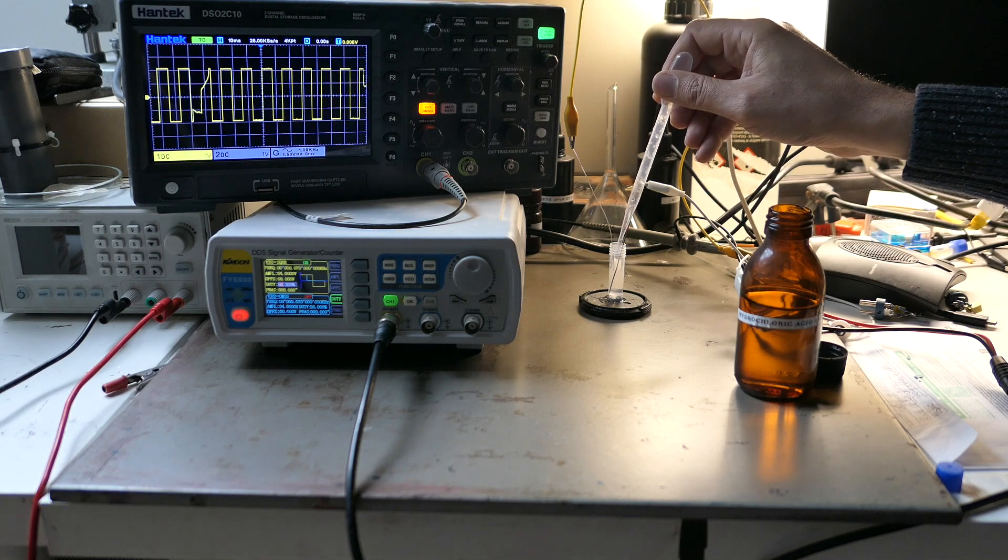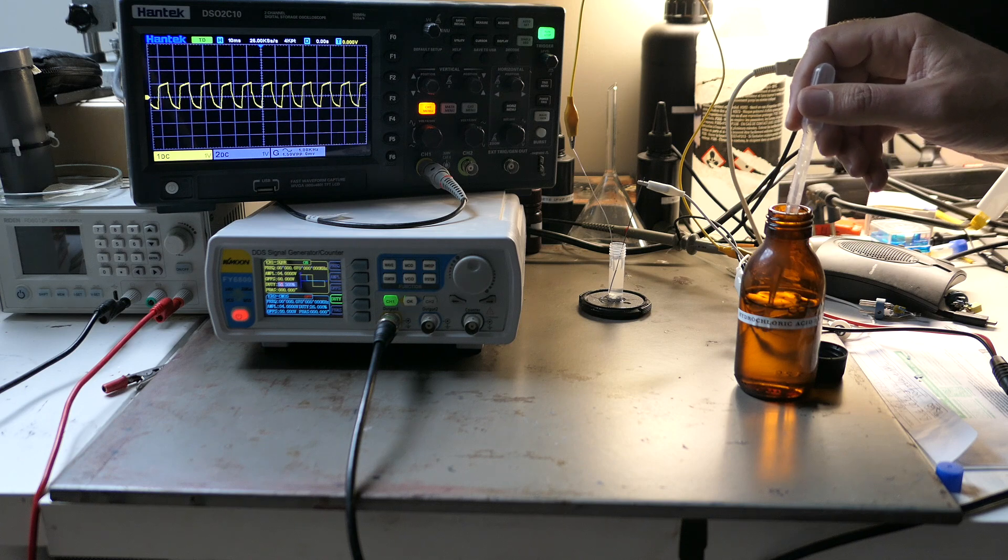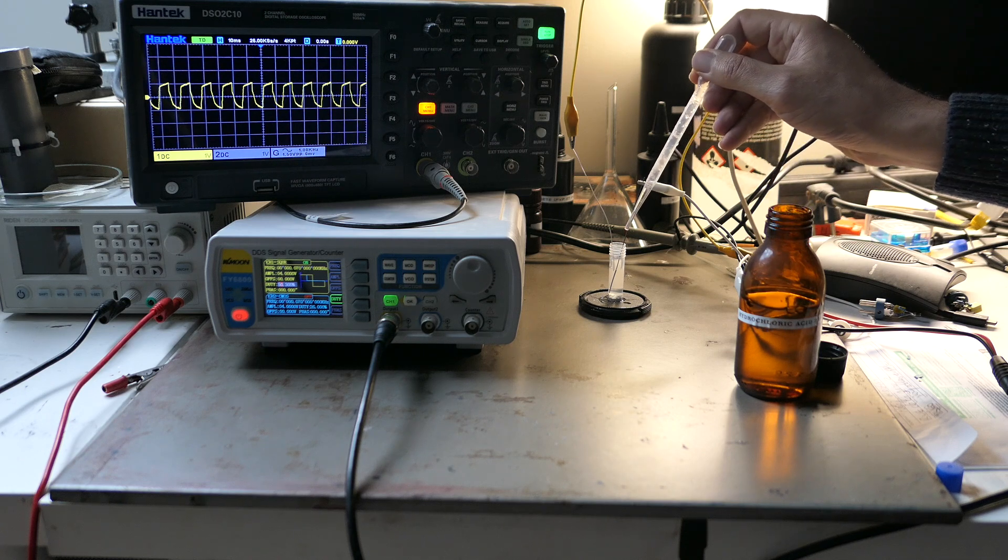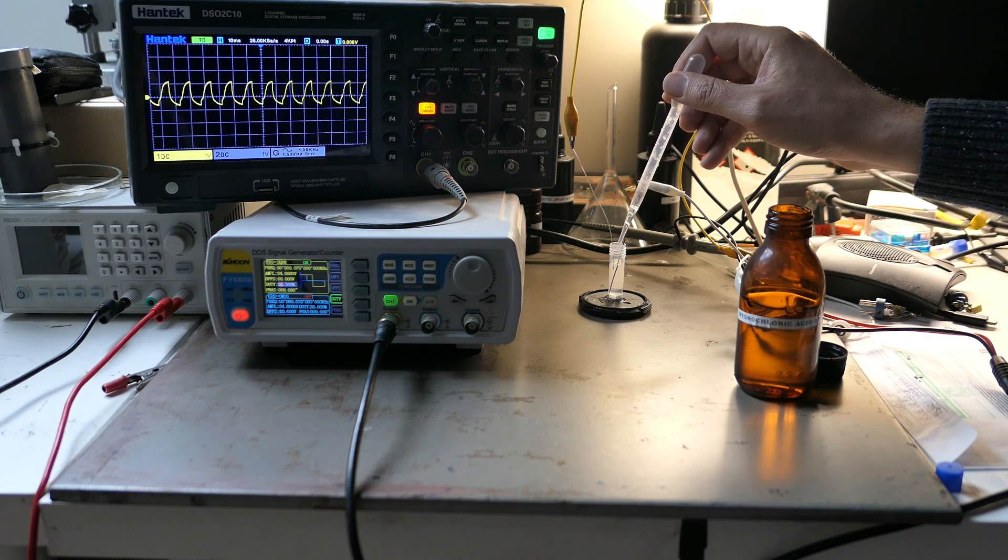Now that everything is set up I'm going to pour in the hydrochloric acid. This is a 23% solution but I don't think the exact concentration is crucial for this process.